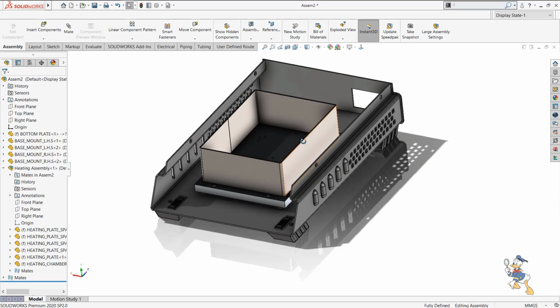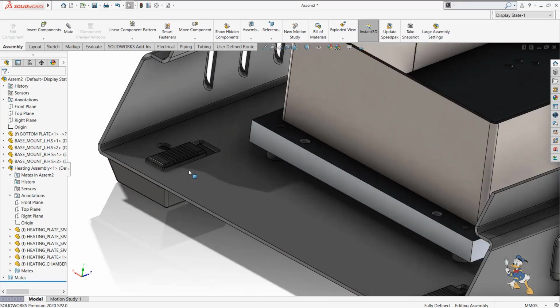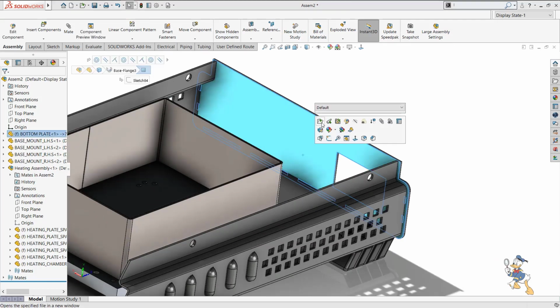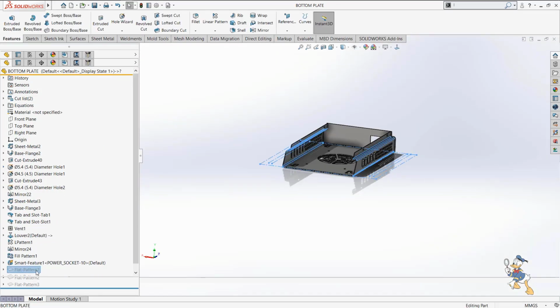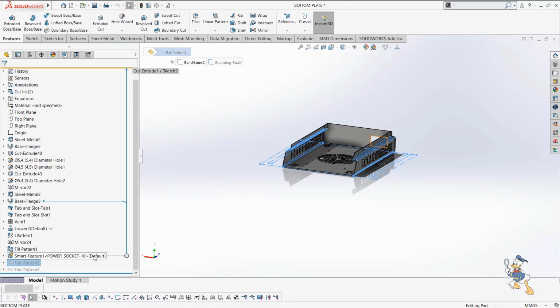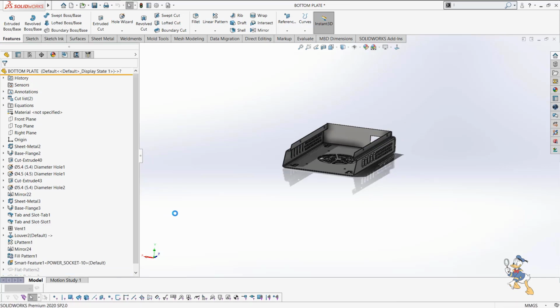Yeah, I need to replace it with this, and I replaced this component very easily because that part was the oldest one which we had designed. This part is the newest one, so I just need to generate it. So this is one possibility which we can do in SolidWorks. If we want to replace it only, we can replace it very easily. This is the feature which is available in SolidWorks, which reduces our time consumption very easily.